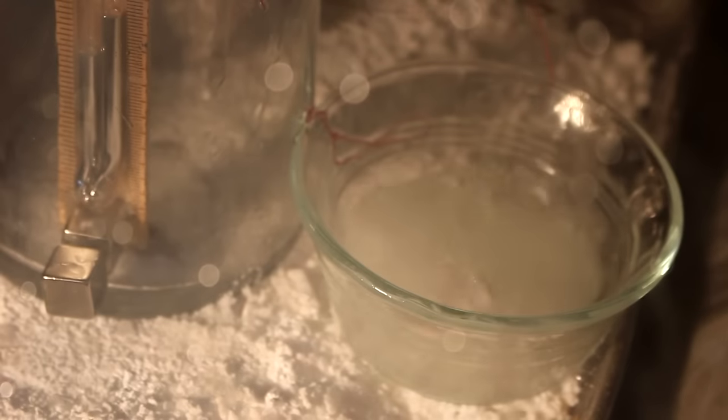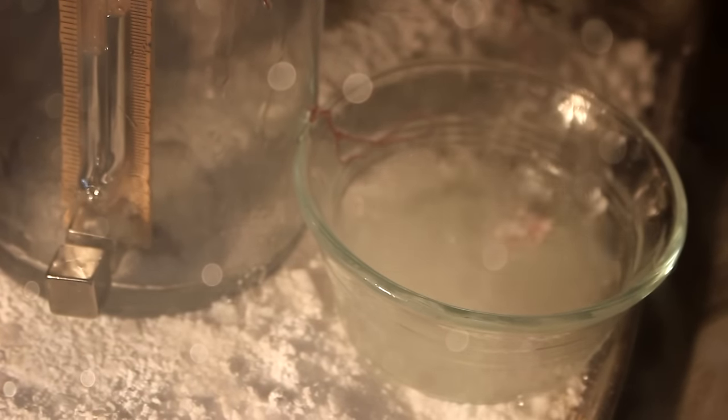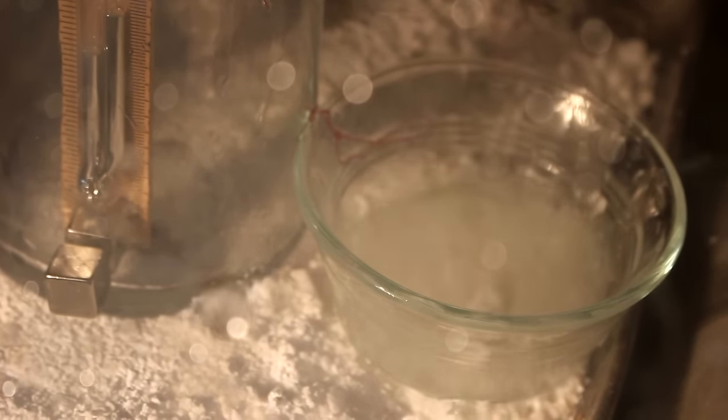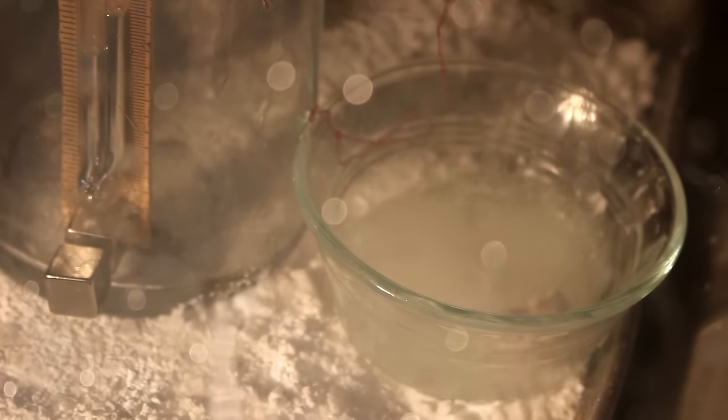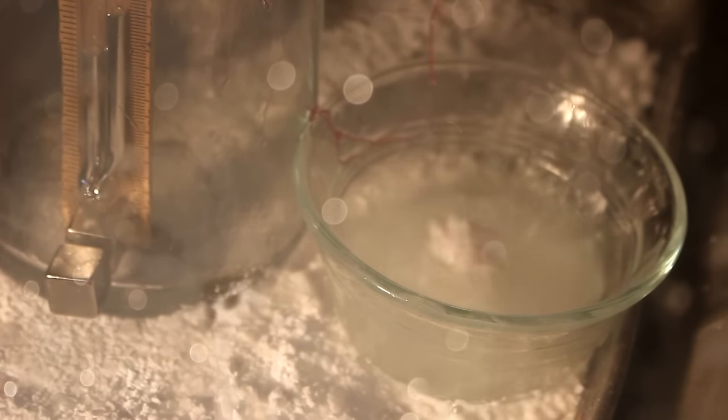I decided to try the experiment again with a more substantial piece of material. Unfortunately, it fell off of the string while I was vacuuming. And there it goes. Throwing water everywhere.